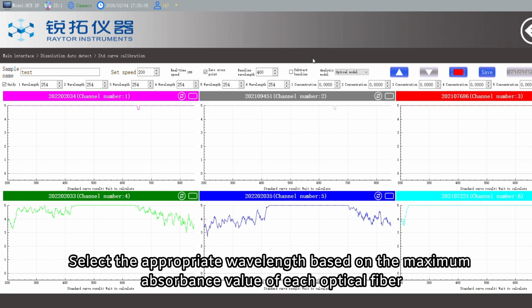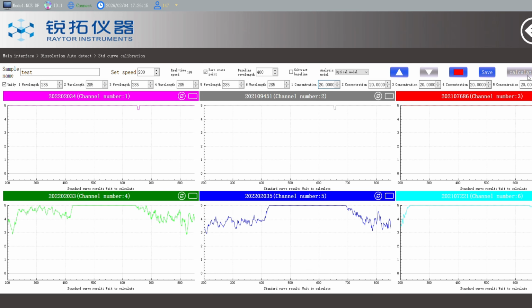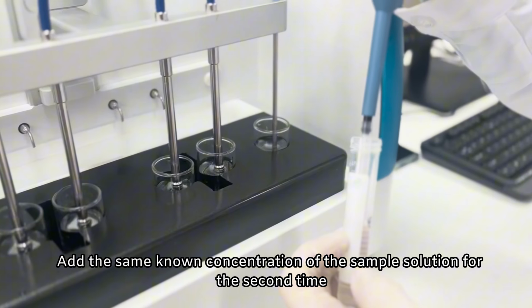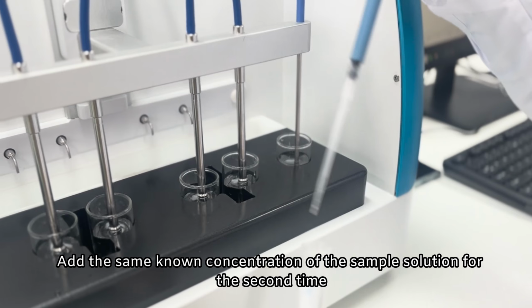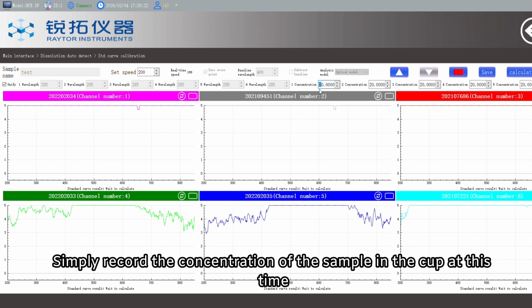Select the appropriate wavelength based on the maximum absorbance value of each optical fiber, and record the drug concentration in the cup at this time. After the record is completed, add the same known concentration of the sample solution for the second time. Simply record the concentration of the sample in the cup at this time.